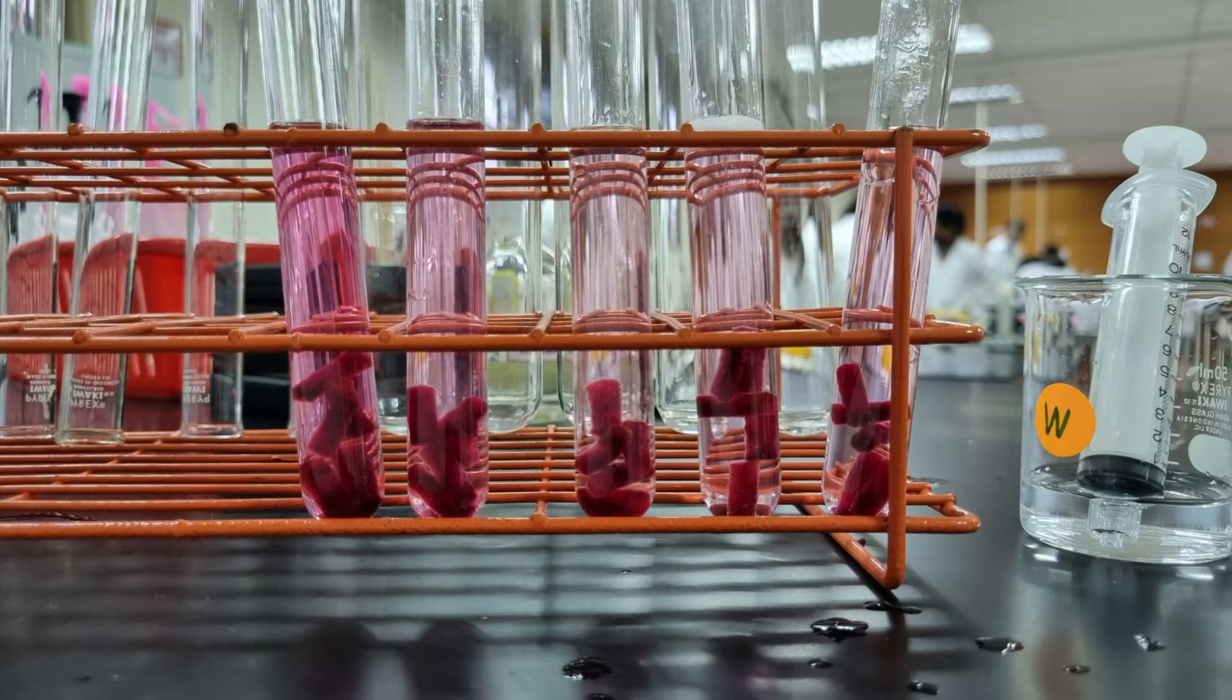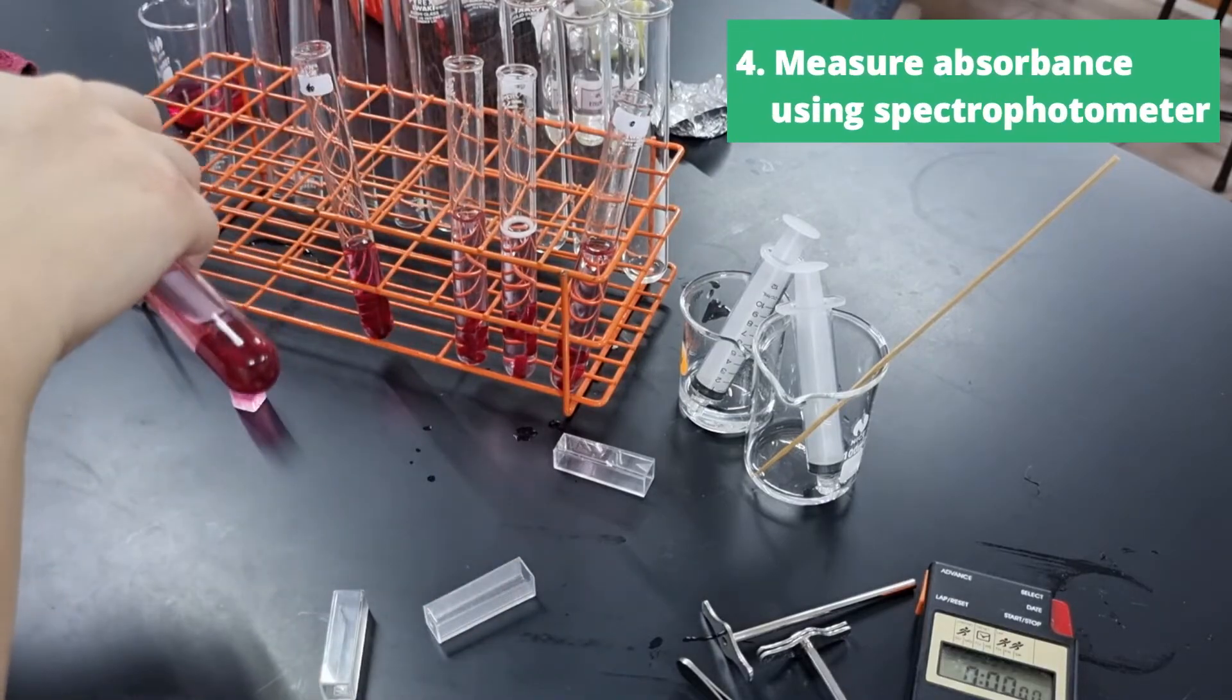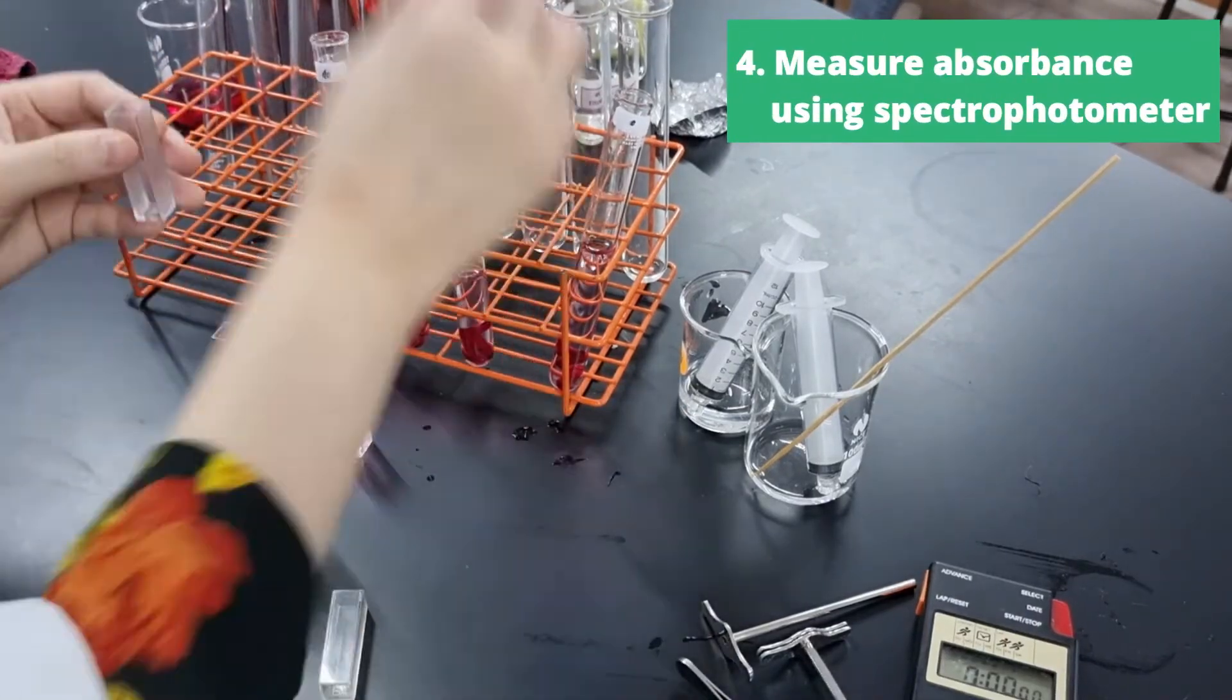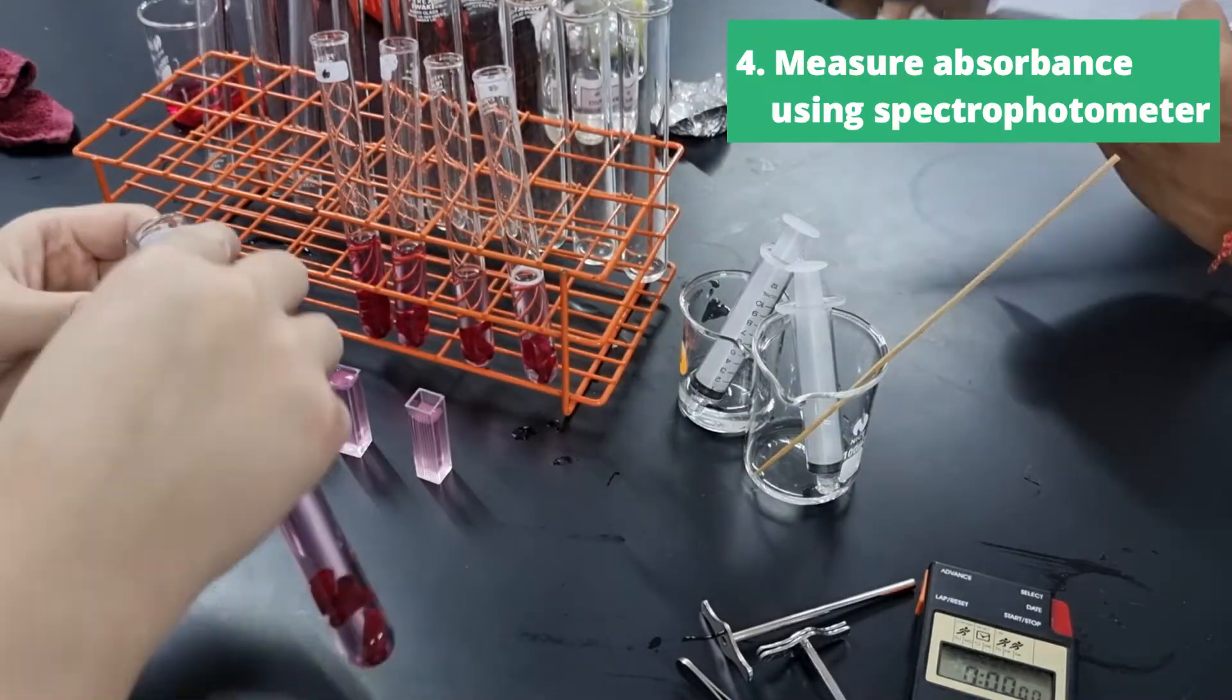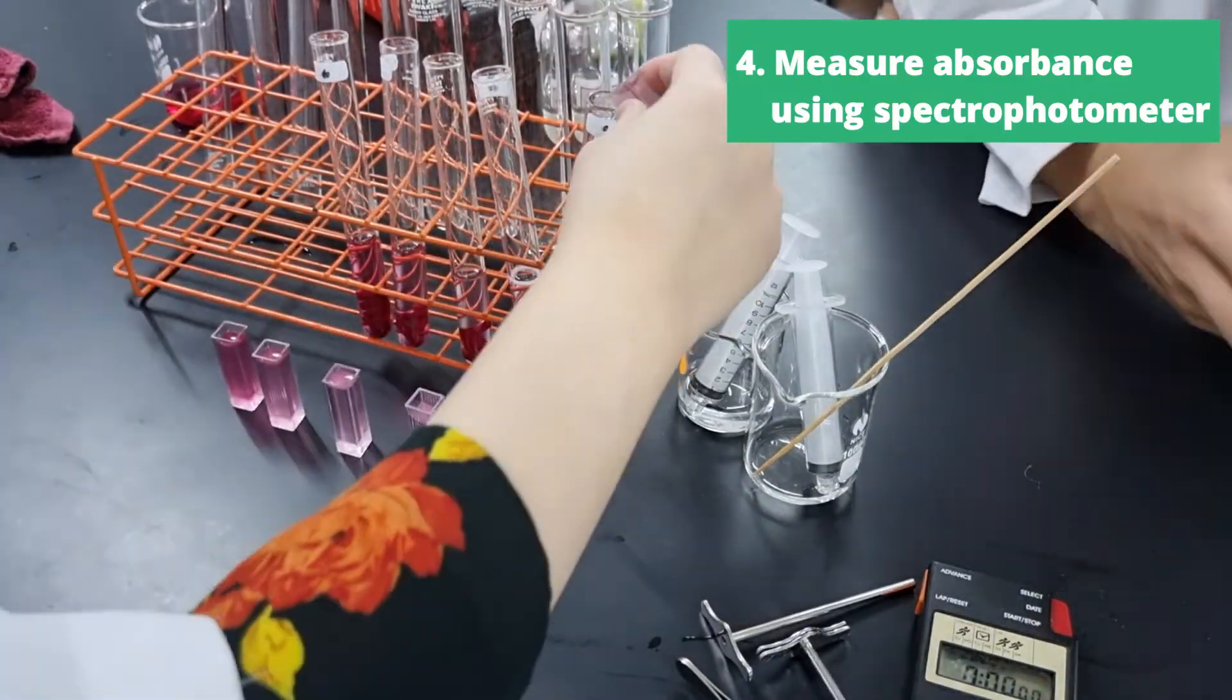Anyways, we can look at this qualitatively and look at the color intensity. But we also should definitely get a quantitative measure of the absorbance using a spectrophotometer. So this is me pouring the solutions into cuvettes. And we're going to take this cuvette and put them in the spectrophotometer.